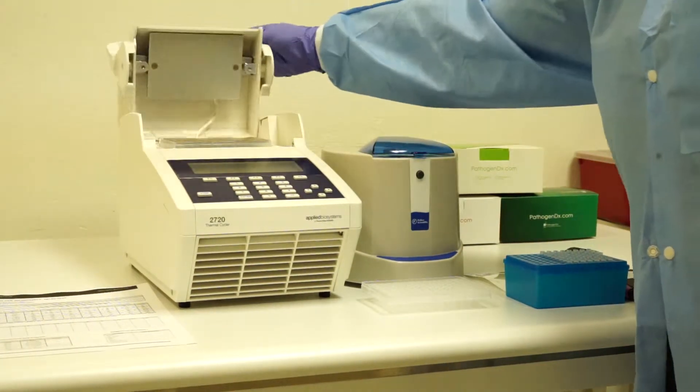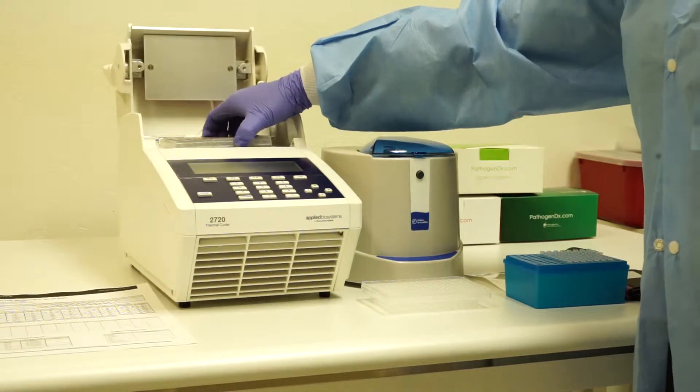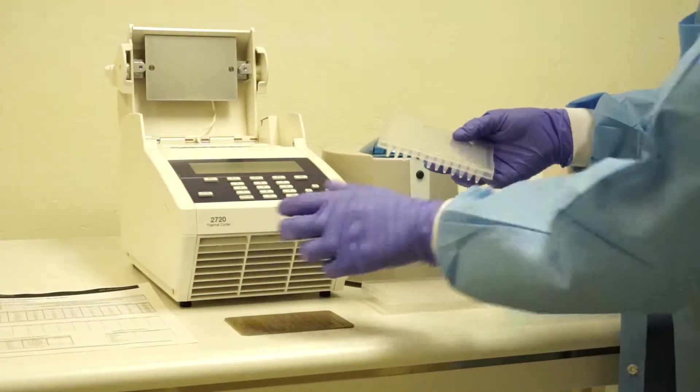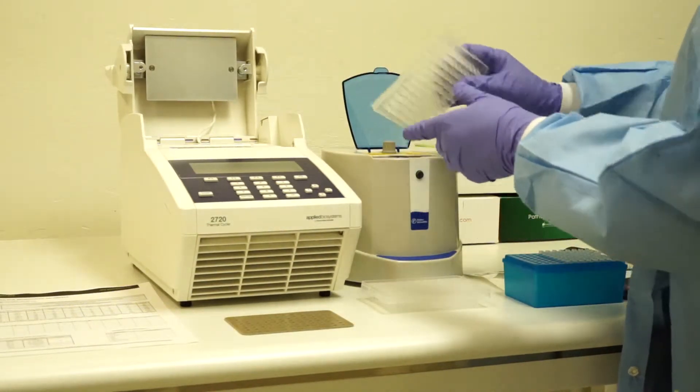Your loci PCR is now complete and may be removed from the thermal cycler. Remove the pressure pad and briefly spin the plate down.